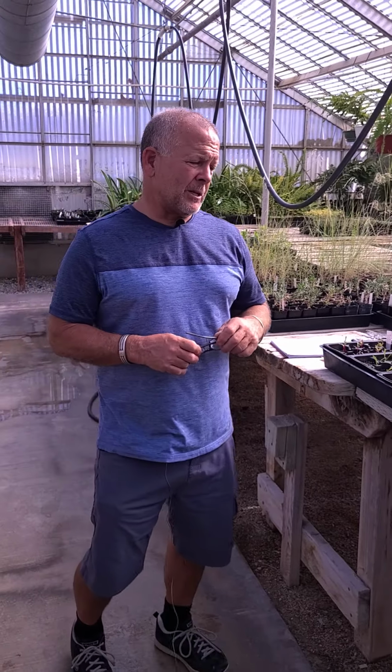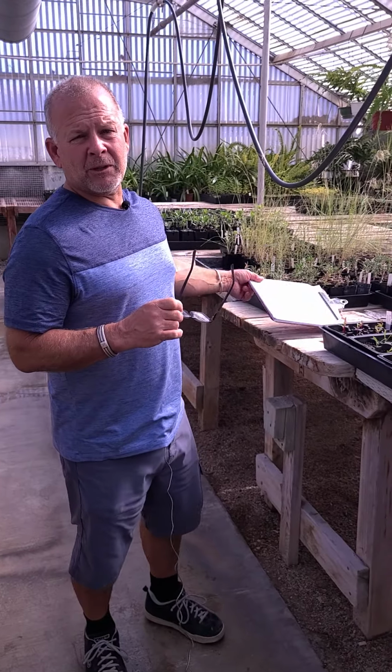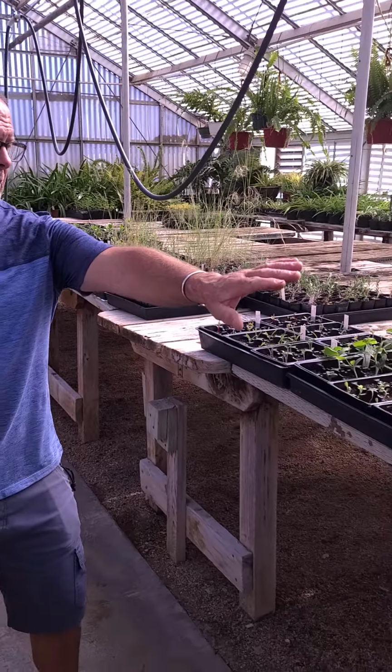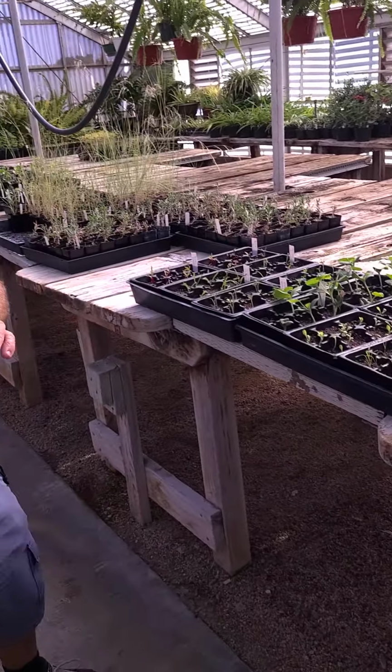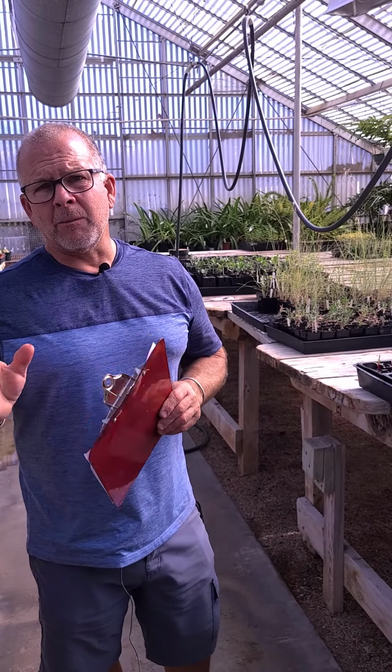So what I'm going to talk about here, and put my glasses on, is I'm going to actually read a little bit from the lab handout, which you'll have available to you. But I want to explain what we're doing here. If you look here, you can see we've got a whole bunch of plants growing. So we started these plants just about the time the semester started, so that we would actually get to this point. And we're almost ready.